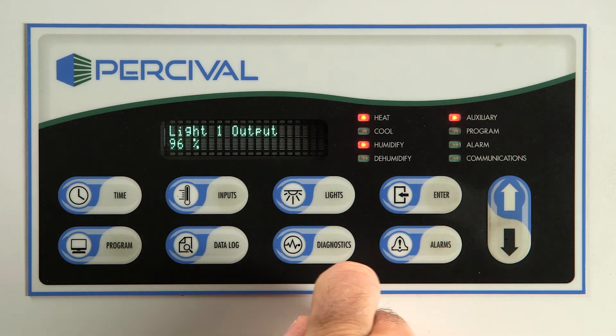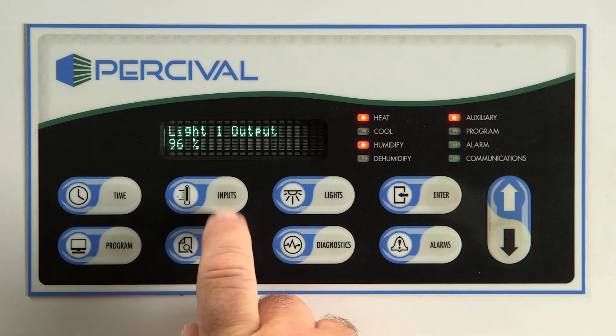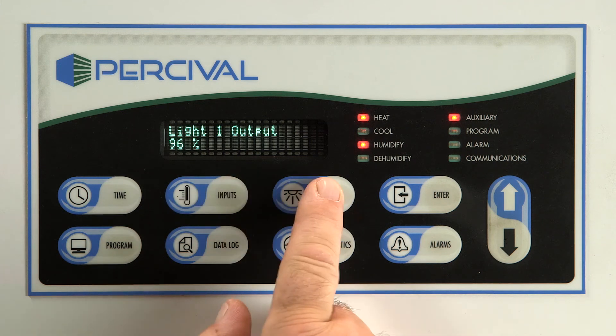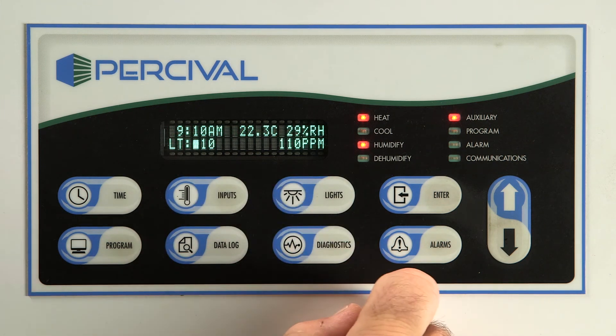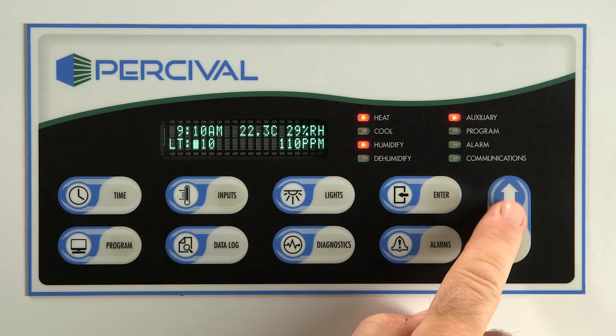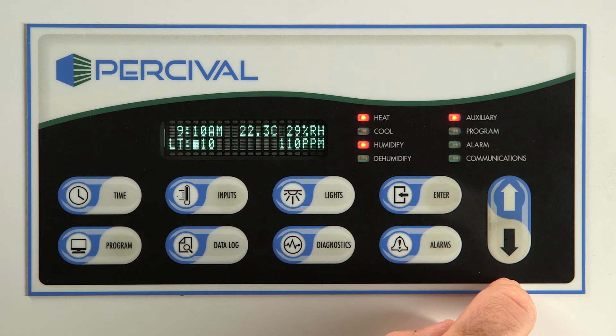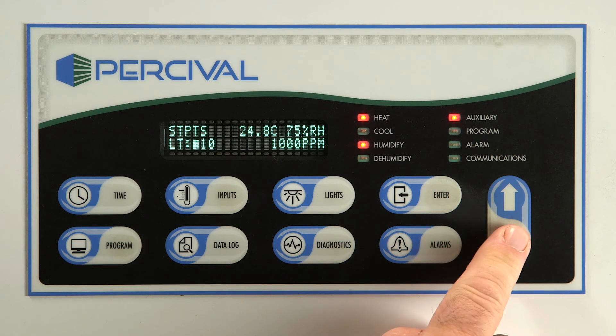The arrow keys are self-explanatory, but will also display current conditions, set point, and when running a multi-step program, the name of the program and the current step.